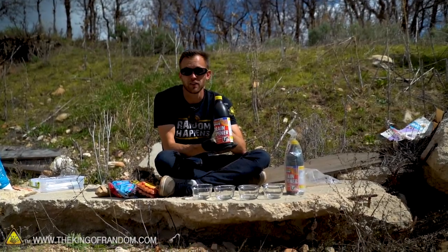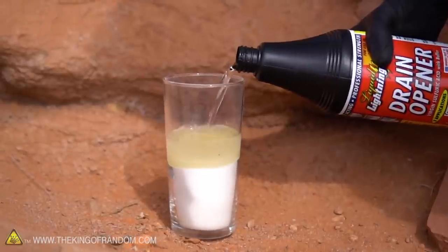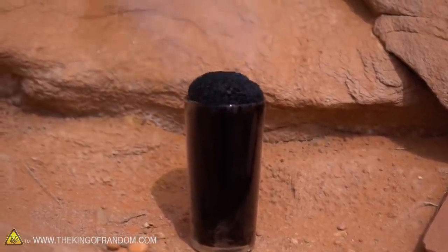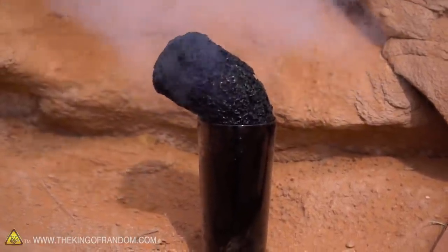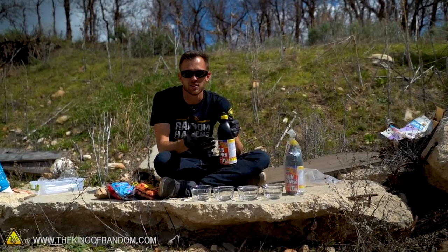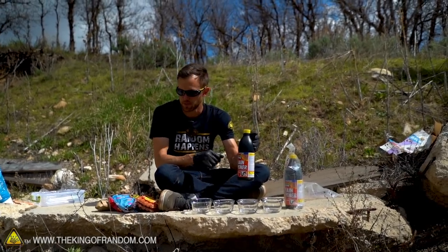This container is almost entirely sulfuric acid. In the past, Grant has done some experiments where he mixed this with sugar and it reacts rather violently, turning into this black foam that expands a lot. We wanted to try doing some more of those with a few different varieties and twists. We're going to try a couple different types of sugar, in and out of sealed containers, and also see what it does to a couple types of meat.